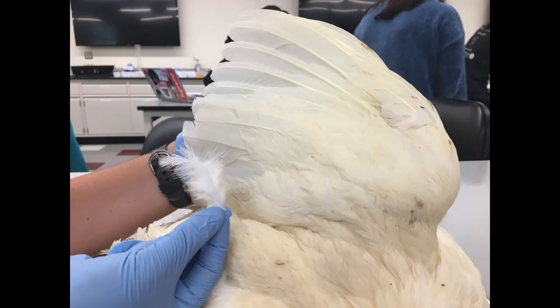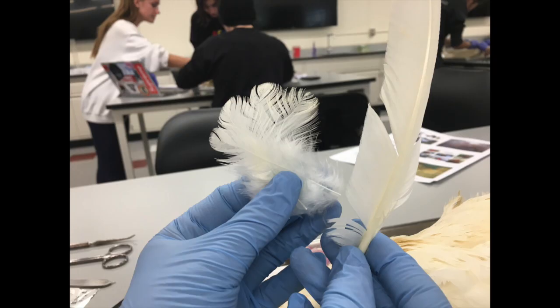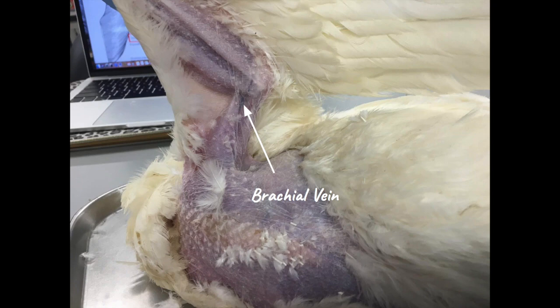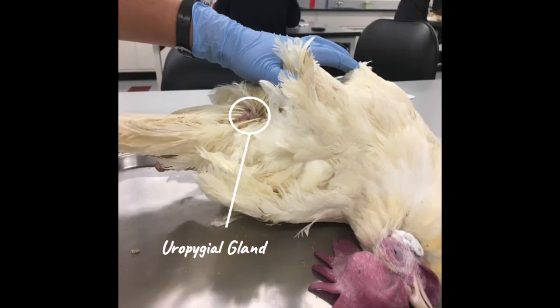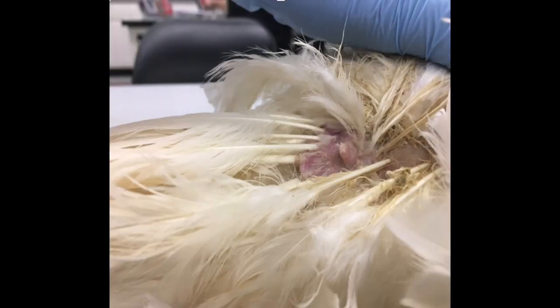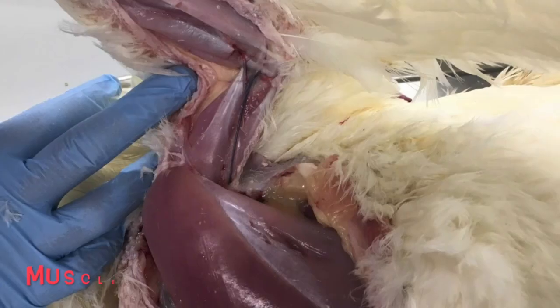The feathers of a chicken are composed of keratin and shield the skin from damage. The brachial vein is a large vein under the wing used for blood collection; it lies between the biceps and the triceps. This is the uropygial gland, or preen gland — it's a sebaceous gland at the base of the tail that secretes oil.